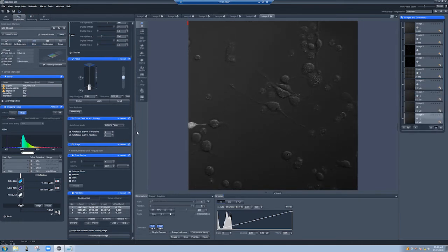All right, so after some tests, it seems that we need to set this to 1 to make sure that every position receives autofocus. And I've set it so that it'll do it every time point in this particular imaging run. Let's see what this looks like when we actually run the experiment.